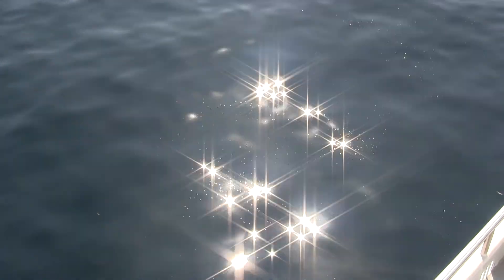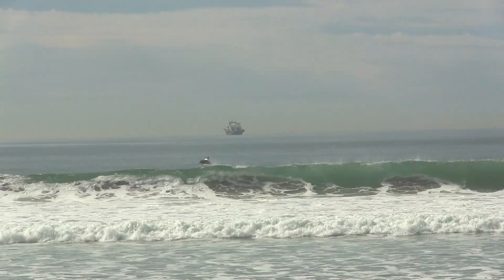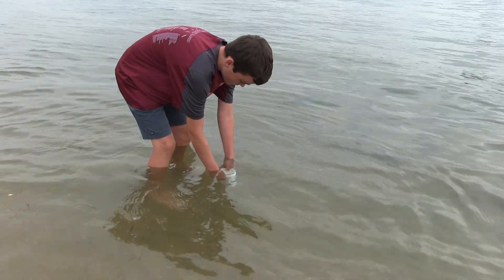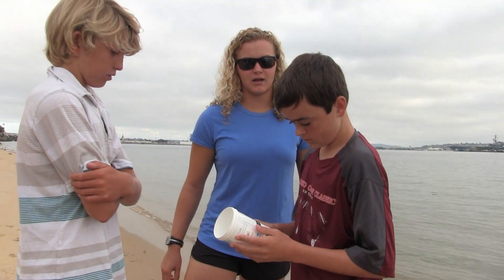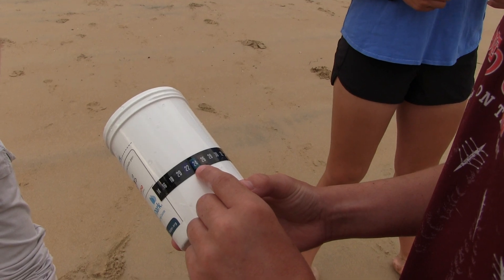Temperature measures the warmth or coldness of the water. This indicator is important because it affects dissolved oxygen, photosynthesis, and the food supply. Waters that are too hot or too cold can have severe effects on fish and other aquatic life. To test temperature, place the thermometer four inches below the surface for one minute. Read the temperature — the number with the green background — and record the number in degrees Celsius.